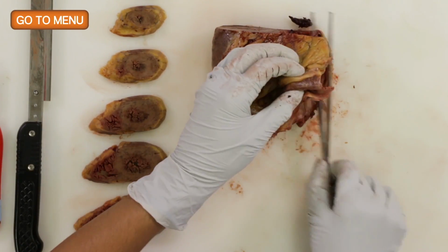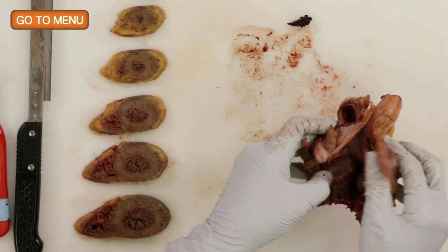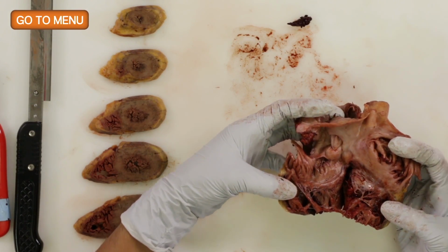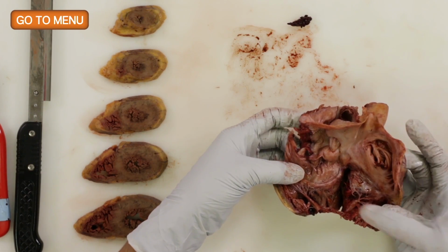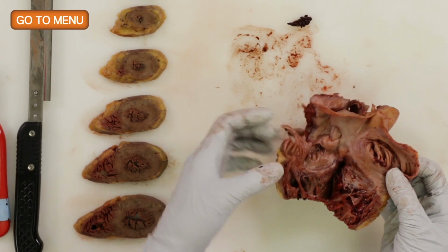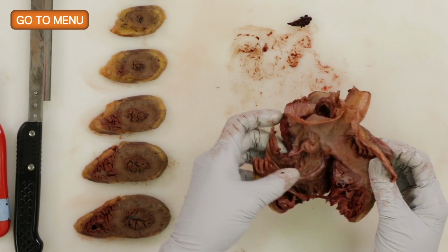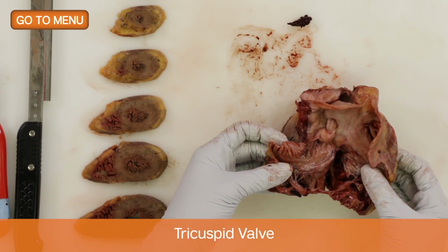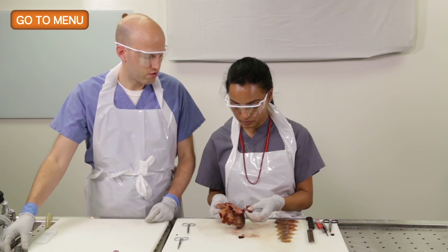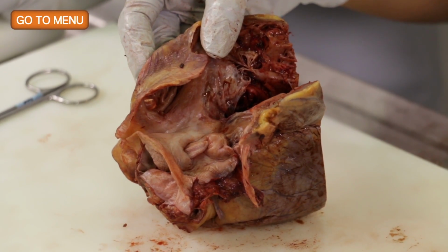All right. So now if we open, and now you can see the right atrium, the upper part of the right ventricle, and we have our first look at a valve. So which valve is this? This is the tricuspid valve. The tricuspid valve, right? So 3 cusps. And we can measure the tricuspid valve. Cut these chordae a little bit more so it's more open.